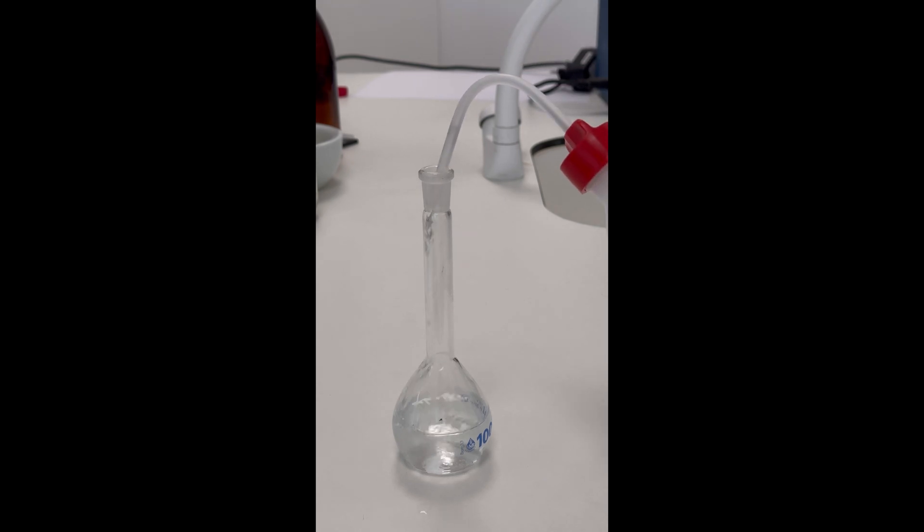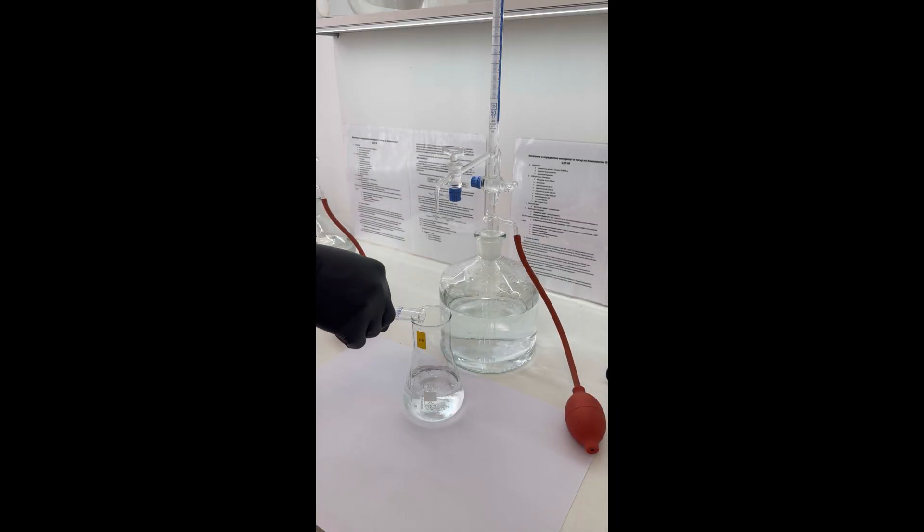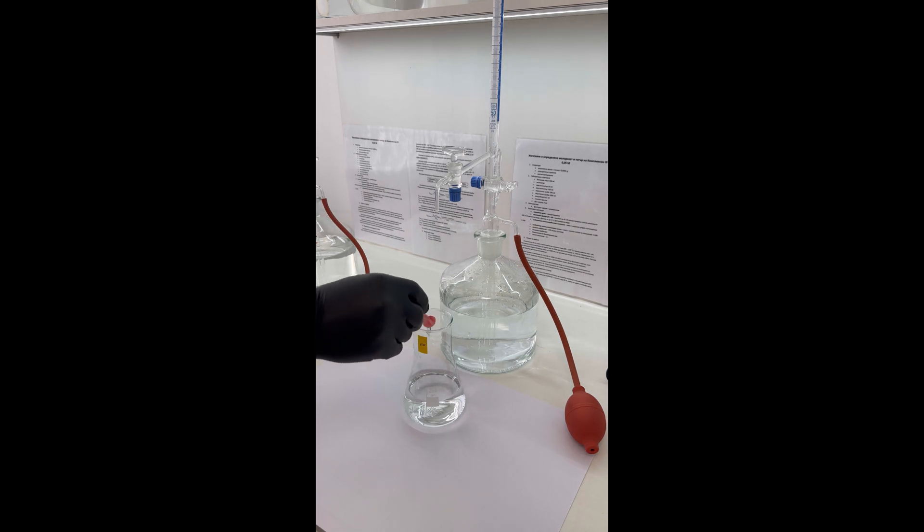After the reaction stops, the solution is topped with distilled water. 25 milliliters of the calcium solution are transferred into a conical flask and diluted with water.